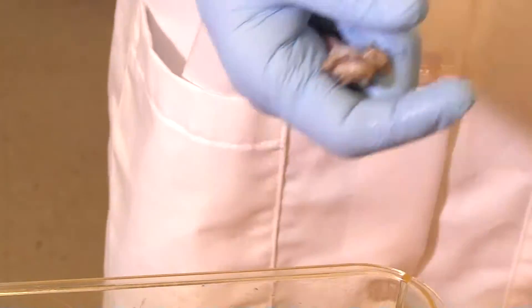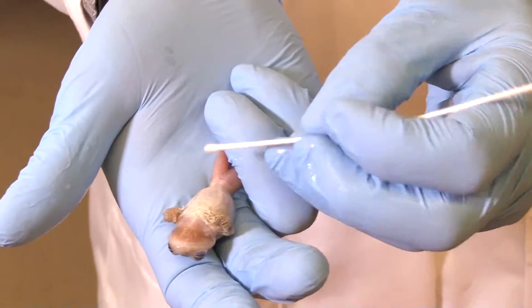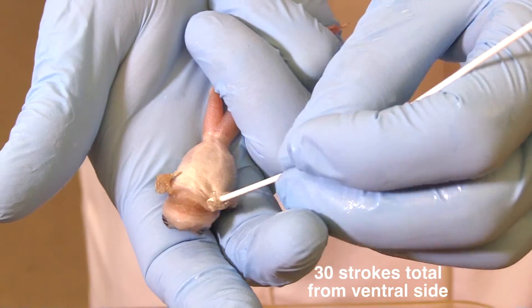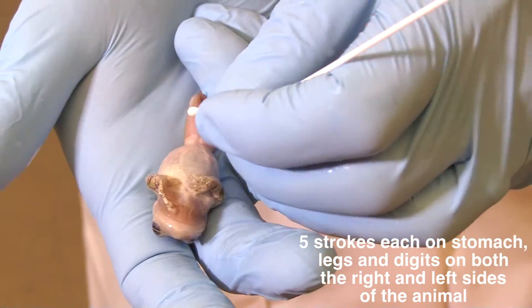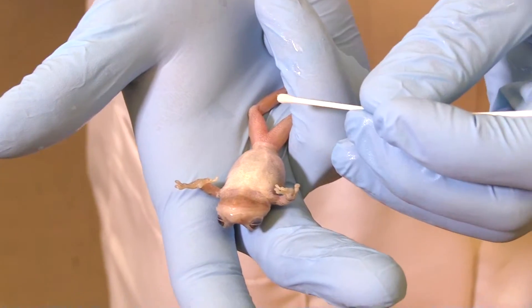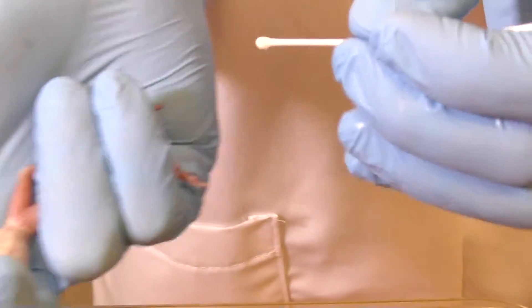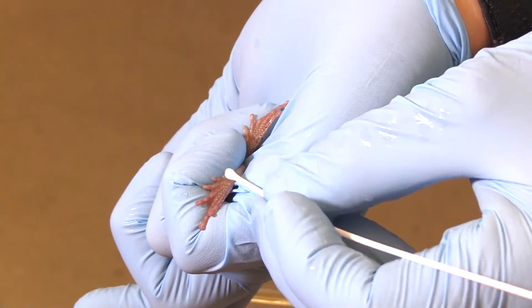I'm going to turn them upside down because the chytrid tends to be more often found on the moist side of the amphibians. So now I'm going to take 30 strokes from this guy on the ventral side — one, two, three, four, five, one, two, three, four, five. That's 20 strokes now. I covered his belly and his inner thighs especially. I'm also going to take the last 10 strokes on the feet, which tends to be an area where we find chytrid a lot.